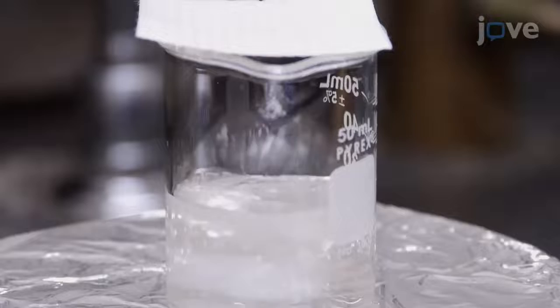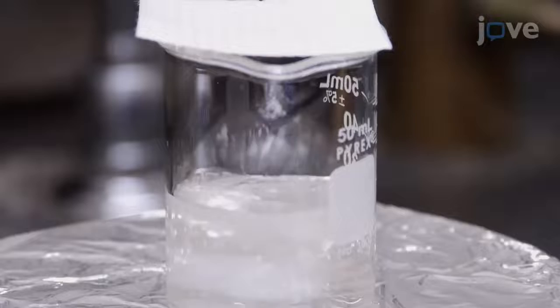After this, transfer the resulting solution to a 50-milliliter conical tube. Centrifuge at 3,900 times G for 1 hour to remove any debris or large agglomerates. Then, transfer the supernatant.